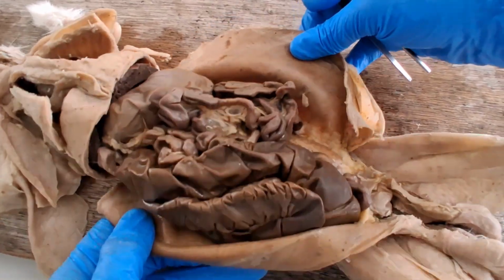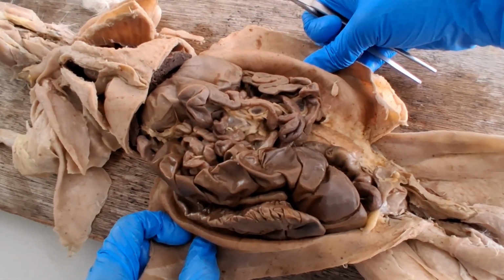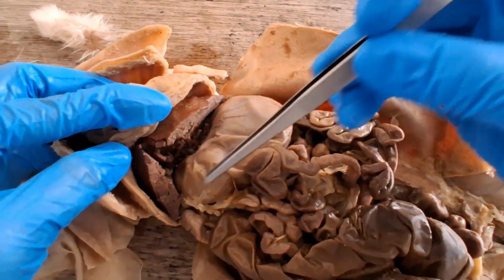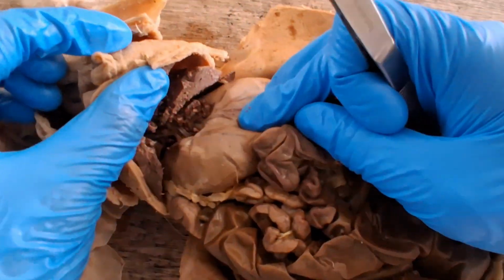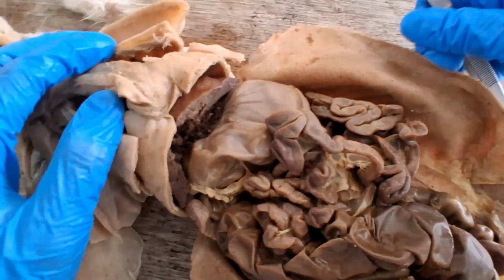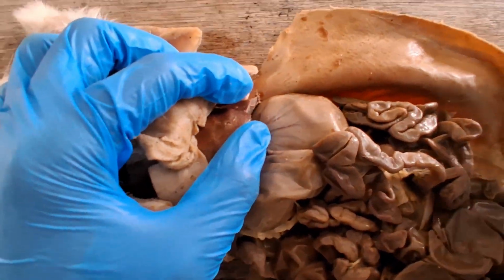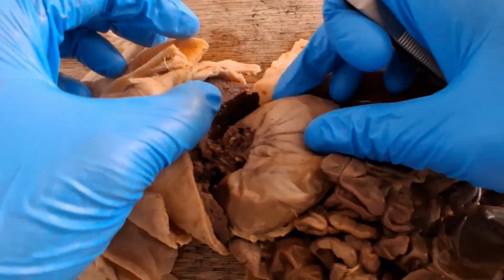In the peritoneal cavity, or also called the abdominal cavity, you'll see most of the visceral organs. So once you open it, you'll immediately see the large lobes of the liver, but in this case I already cut the lobes of the liver to have a better look at deeper structures there. So the liver has a left lobe and right lobe, further subdivided into median and lateral lobes. You can look up the cat video. It's practically the same structures in the cat.